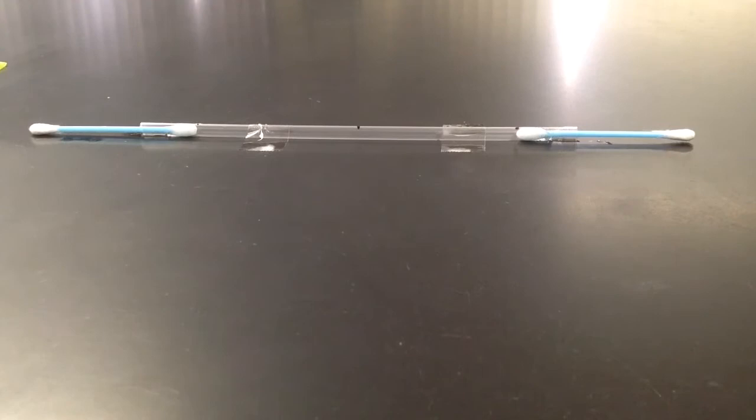And as we watch, we will notice that the two gases, as they diffuse through the straw, will begin to make a very faint line just to the left of that midline.